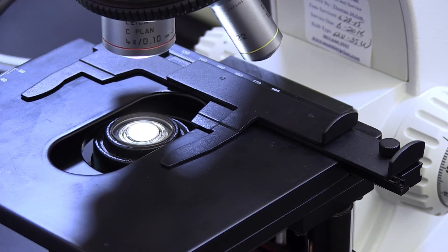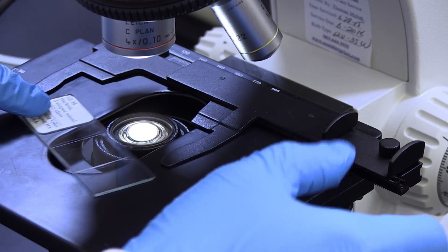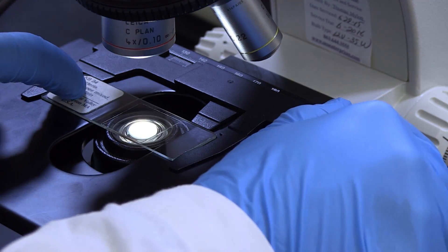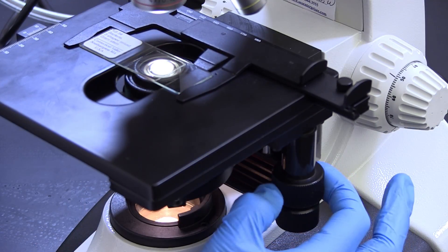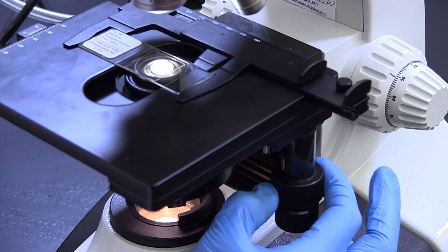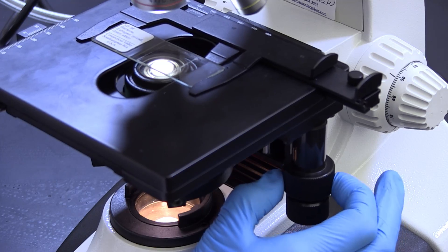The platform that supports the slide is known as the stage. Most microscopes have a clamping device known as the mechanical stage which allows the slide to be held and moved with more precision.